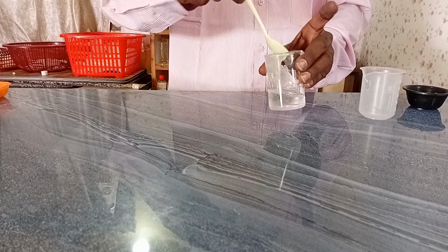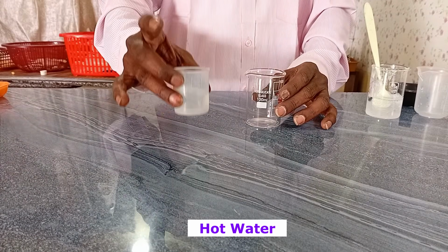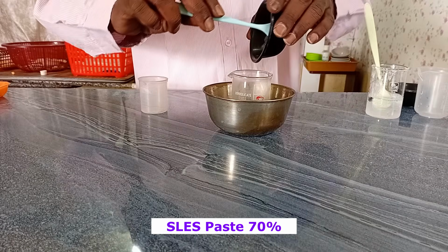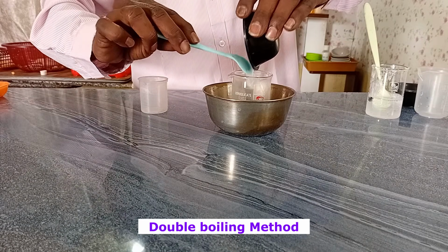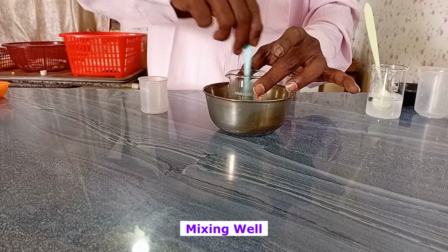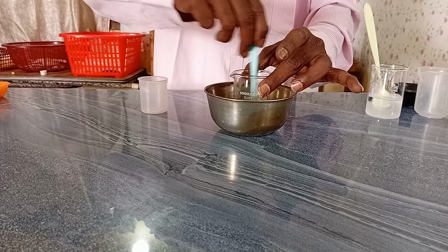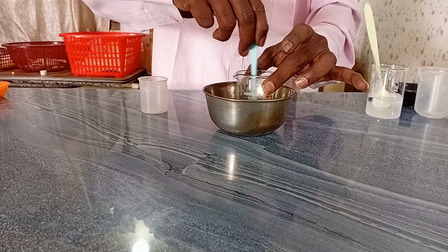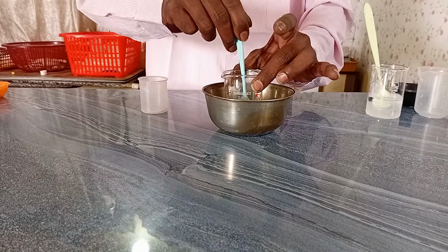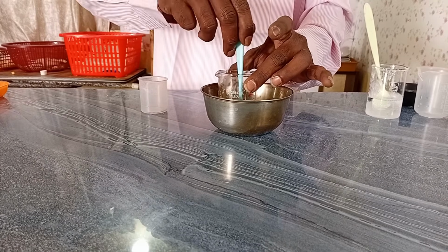Next, I will try in the correct sequence. Of course, this is 30 ml hot water, 60 degree temperature. I am charging SLES paste 70%, 20 grams. I am maintaining the temperature by means of the double boiling method. Mixing well. Here also, I am not getting a homogeneous medium, a homogeneous gel. Of course, better than the previous one, but now also it is not the perfect gel, perfect medium. It may be possible with prolonged mixing, prolonged heating, but it is not smart work.